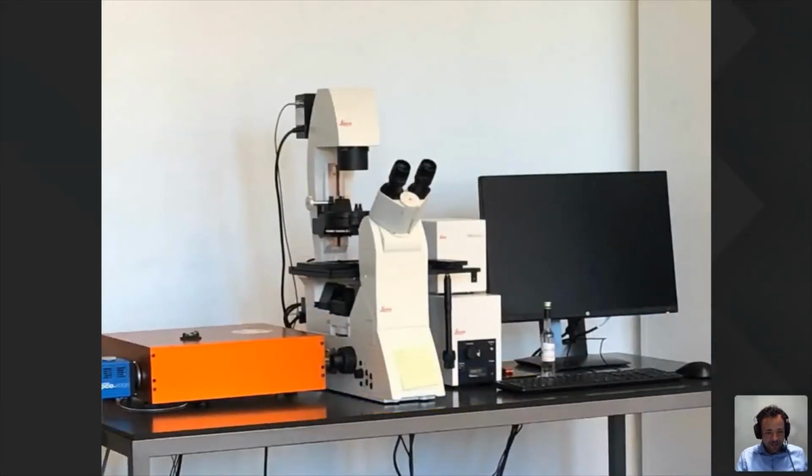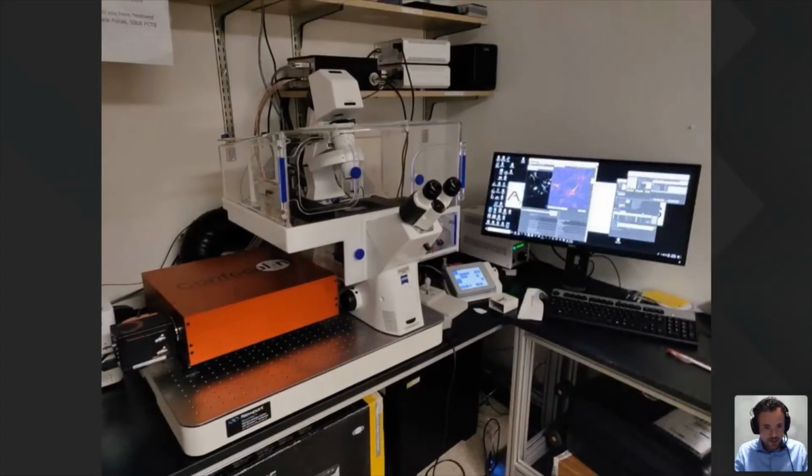Now I'm going to show you some setups, some customer setups. This is a Leica DMI8 microscope. On the left port we mounted the RCM with a PCO camera, and then here we can see a system at Johns Hopkins University in Baltimore, which is a Zeiss Axio Observer. And to the left port we find the RCM. We've attached to that the Hamamatsu camera, Flash 4.